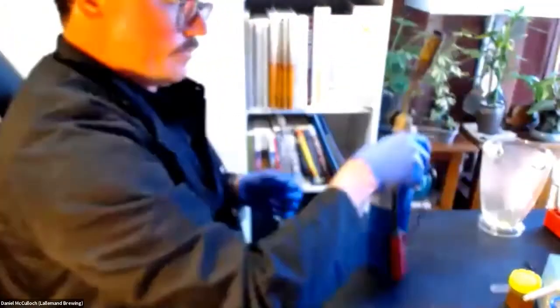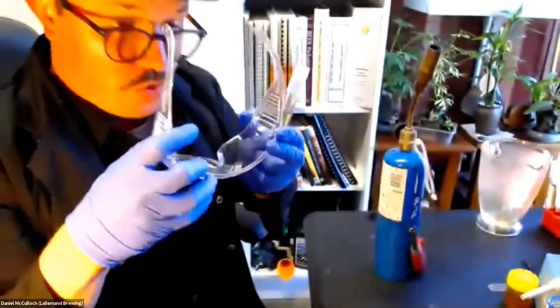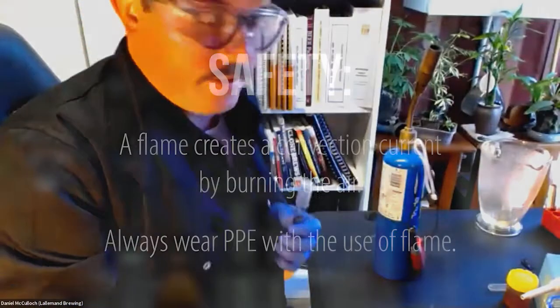So, to give you an example of inoculation, because you're going to be working with flame, and when you open that pressure cooker, you want to have safety glasses on, just in case.